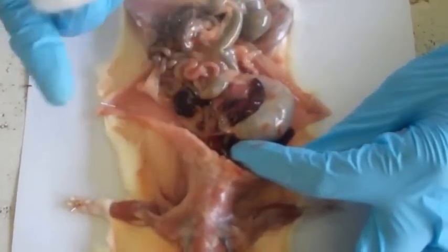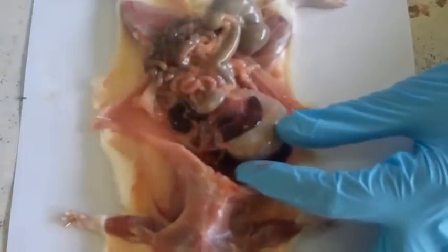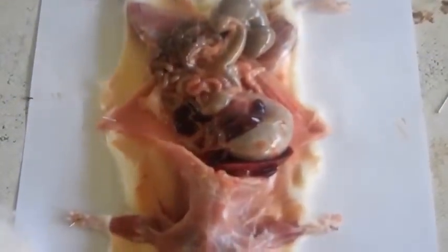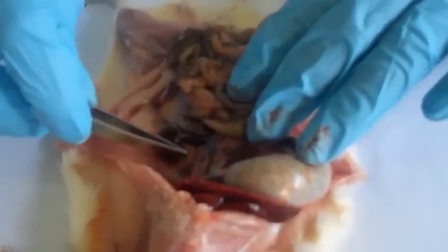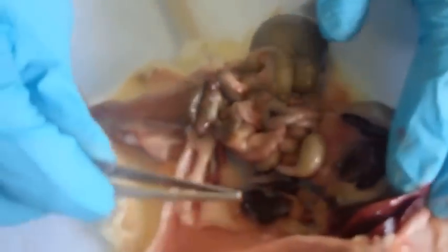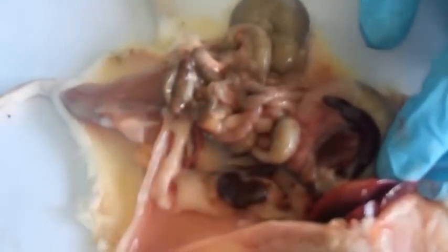Right next to the colon, we have some lymph nodes, and there are 7 in number. Then we have the mesentery, that's right about this. So as you see, the spleen comes along with the stomach because it's attached to it. And then, okay, this is the kidney. And then this is the lymph node, just right there. And then this is the adrenal gland.